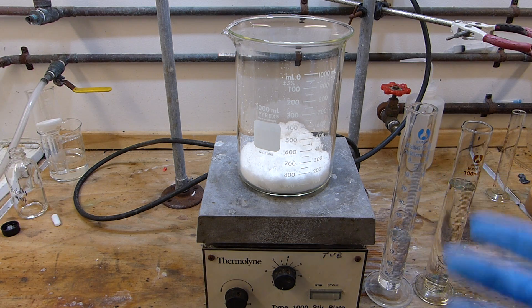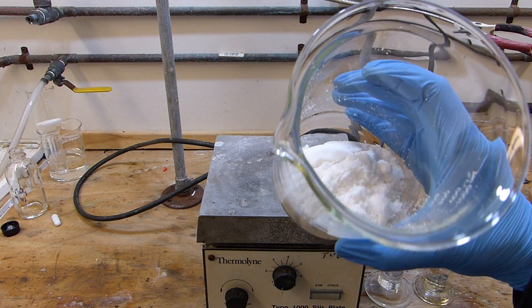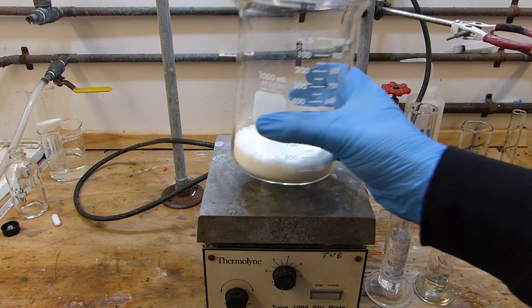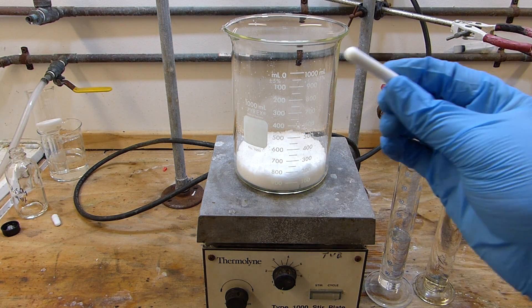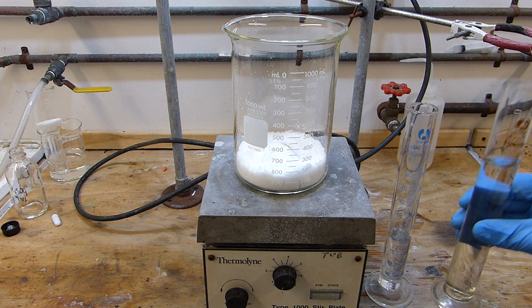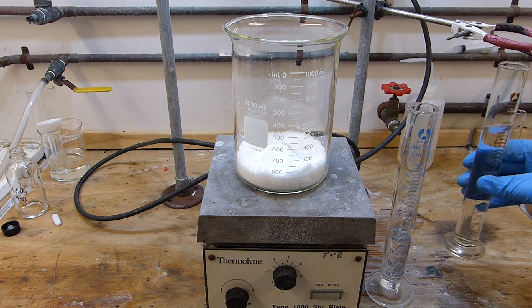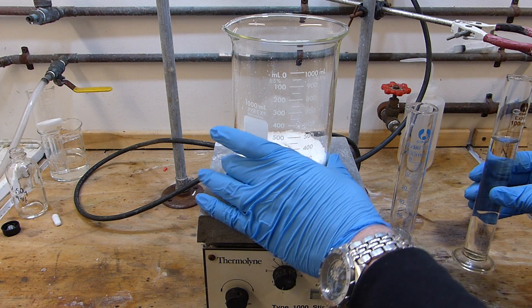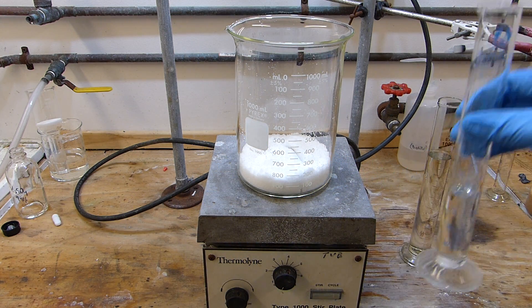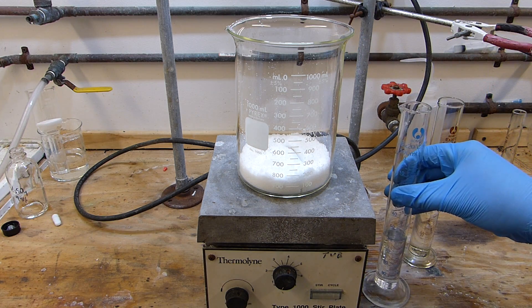All right, so I've got the required ingredients measured out. I've got 126 grams of oxalic acid dihydrate, which is just a fine crystalline powder. To that I'm going to add a stir bar, because we're going to heat and stir this. I have 90 milliliters here of methanol, which I will slowly add into this with stirring to make sure it dissolves. And then very slowly after that will be 40 milliliters of sulfuric acid.